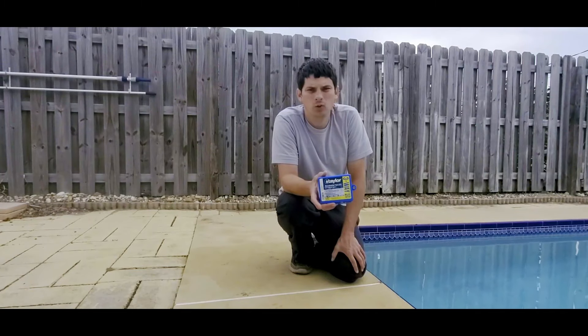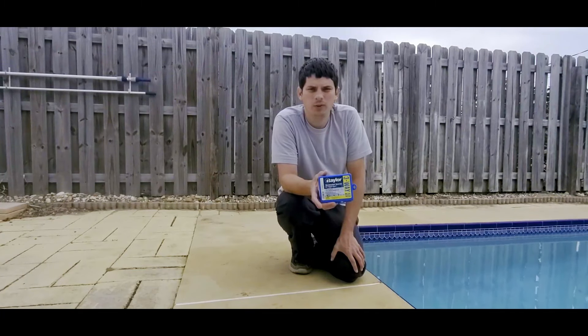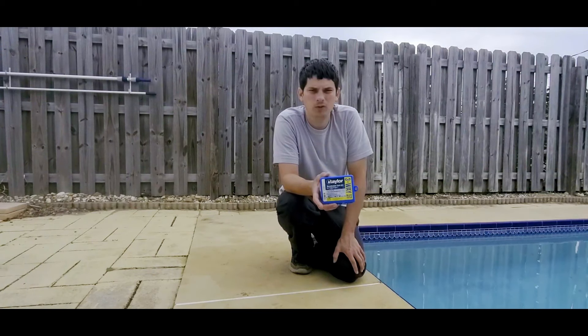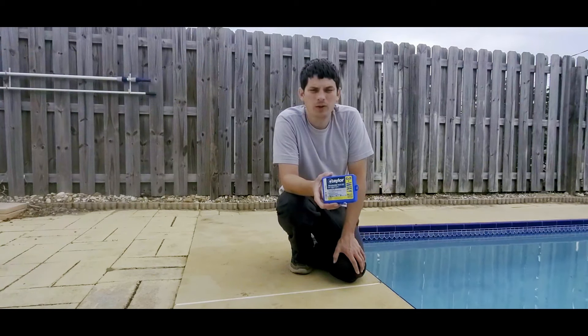Today we're going to be talking about this Taylor Chlorine and pH test kit. It's a really simple kit to use and it's a lot more accurate than the little strips that you use in the pool. So stick around and we'll show you how to use it.